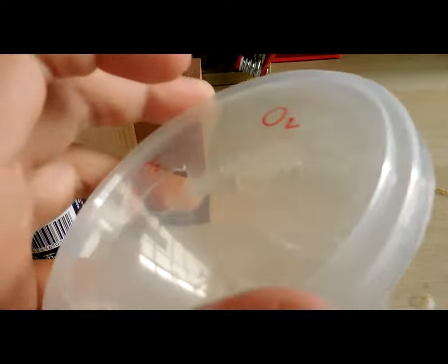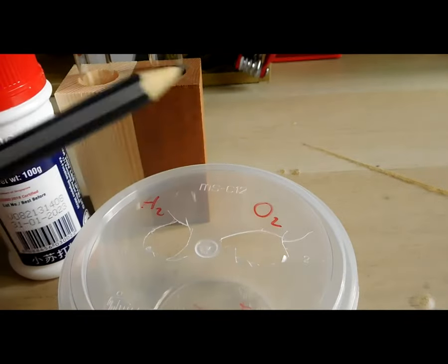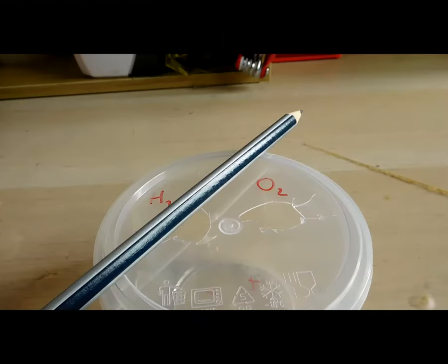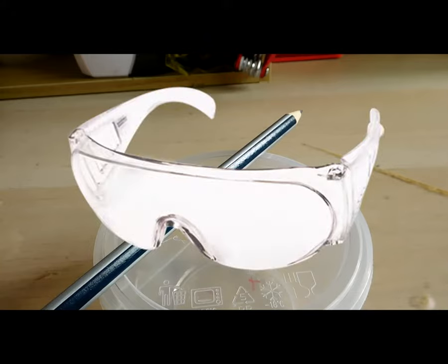You will also need an electrode, and I just went with pencil graphite which is basically an allotrope of carbon. As always, for all experiments you may need to use safety goggles to protect your eyes.